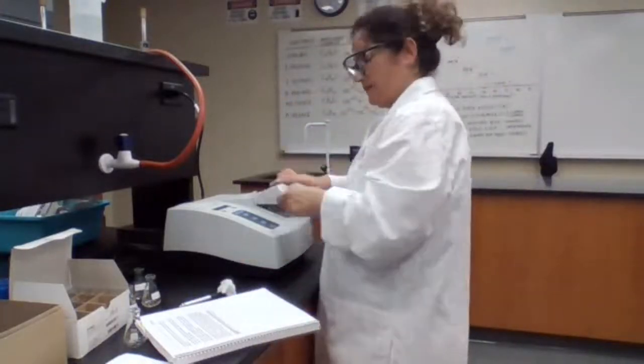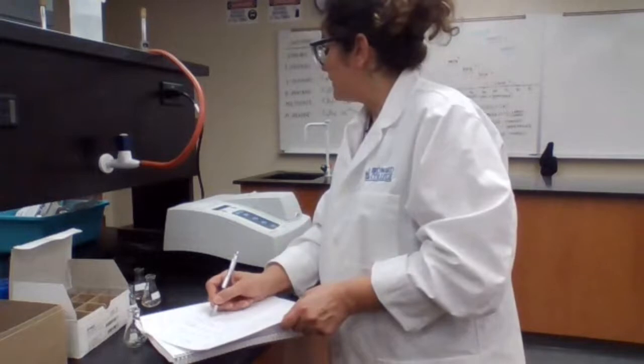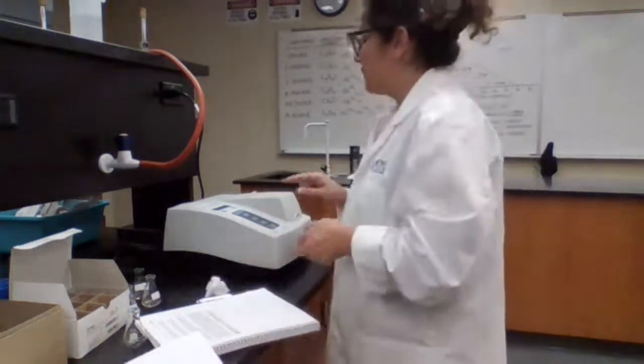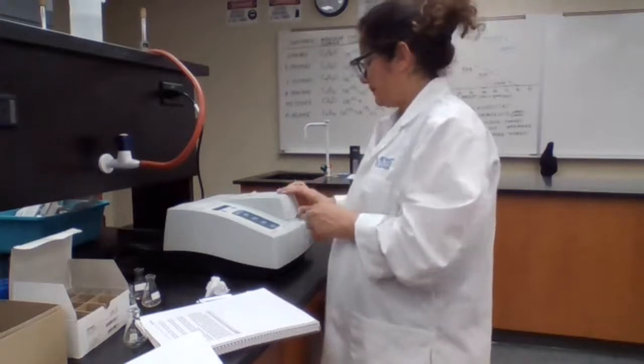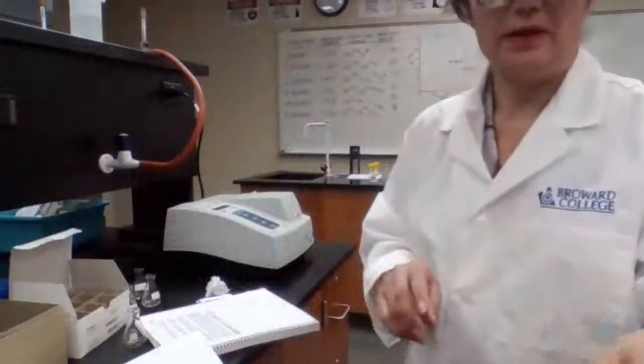Place the sample in, and we record the number. 74.8%. 74.7% because it changed, and then from 74.7 it stayed constant. Okay. Now, going to make my unknown A.